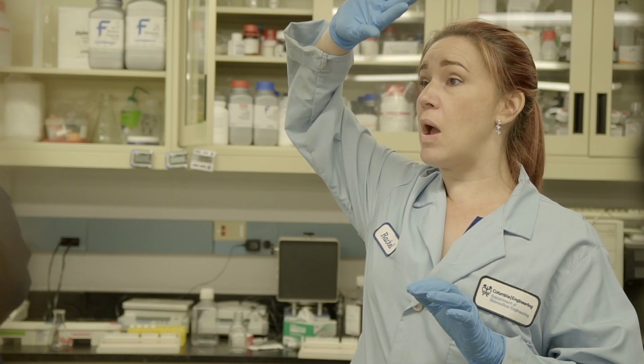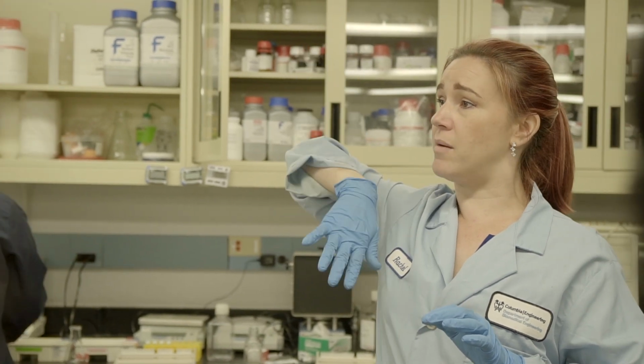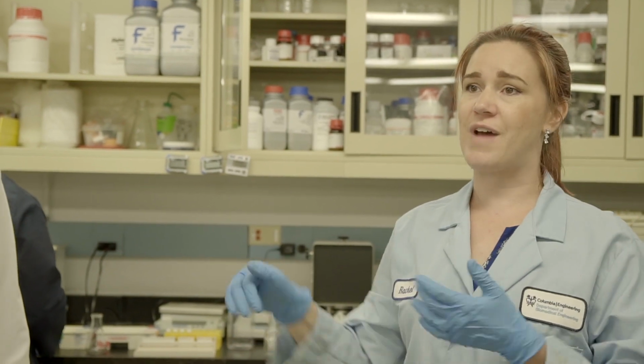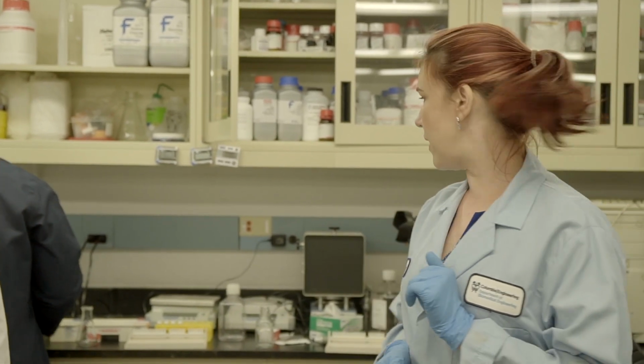So they'll be where on the gel at the end? The top or bottom? The top, right? And then the little ones can wiggle through the pores much faster, so they go down to the bottom.